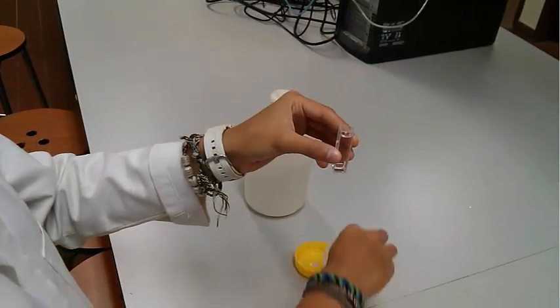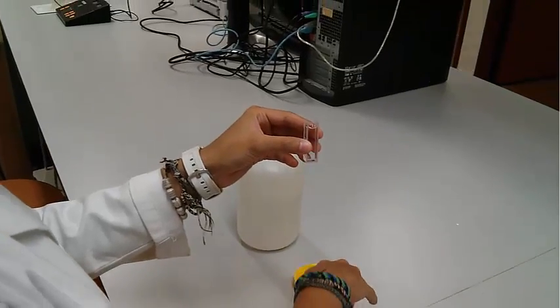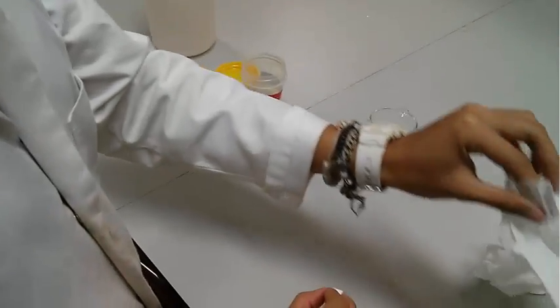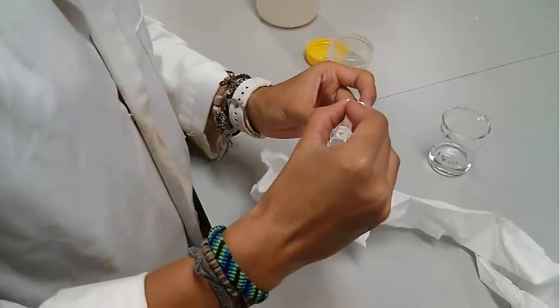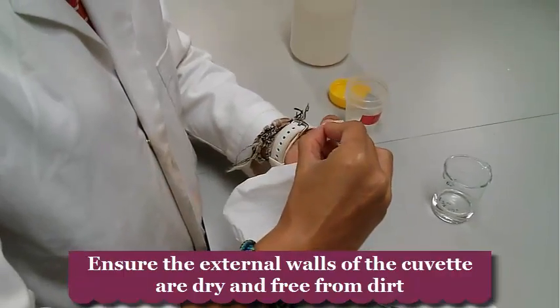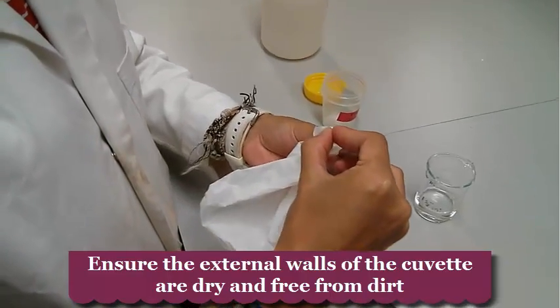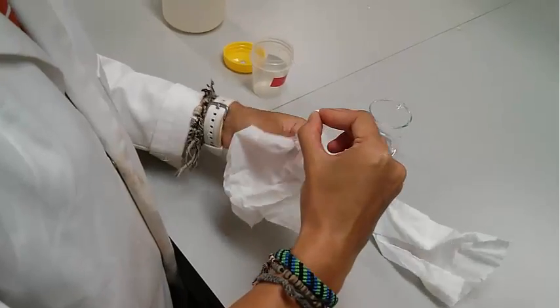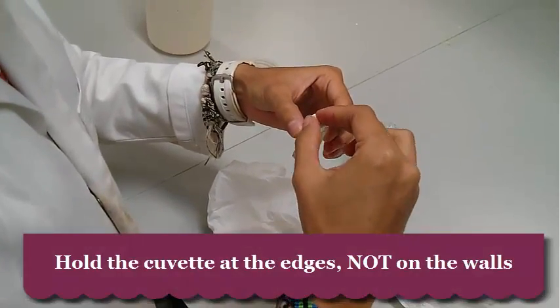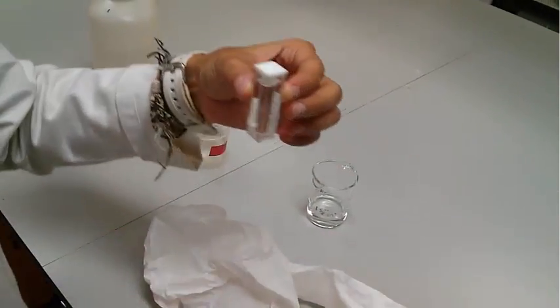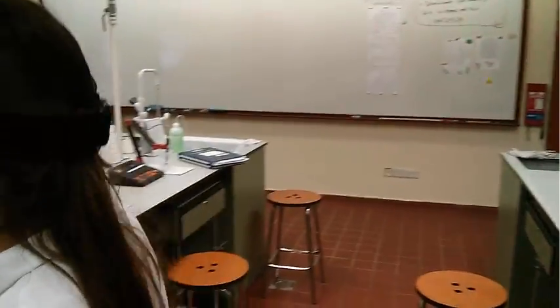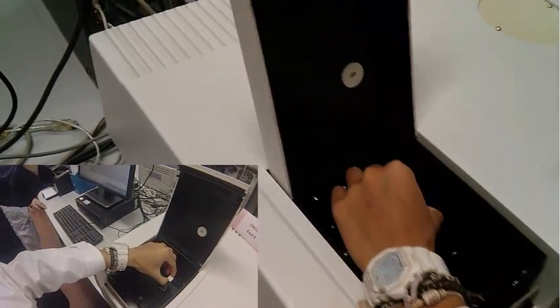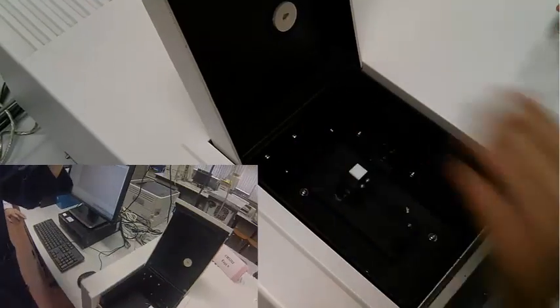Fill up your cuvette to just above the top, and then place the cap on the top. You want to just wipe down the sides just to make sure that there's no water or drips around it. Once you've wiped it, try and hold the cuvette just on its corners like that, so you're not touching the sides which the light's going to be passing through. This goes into our machine. It doesn't matter which way you put it in because it's the same on all sides. Place your sample in there and close the lid.